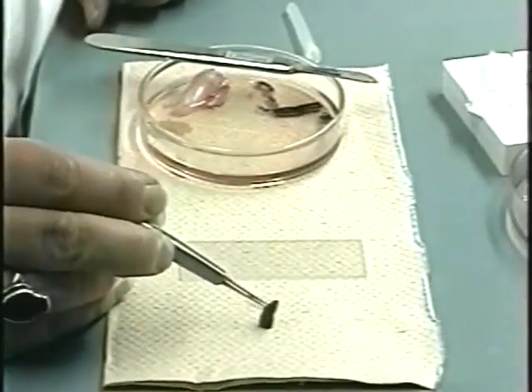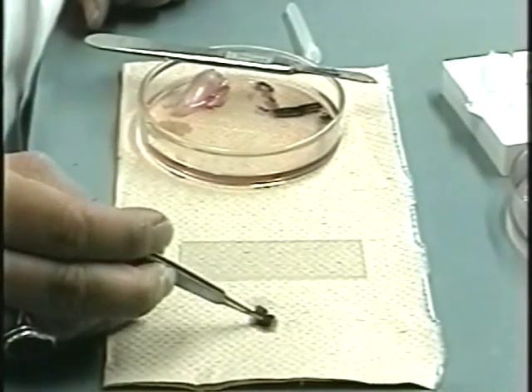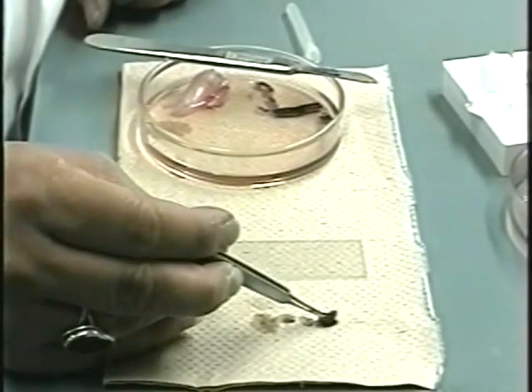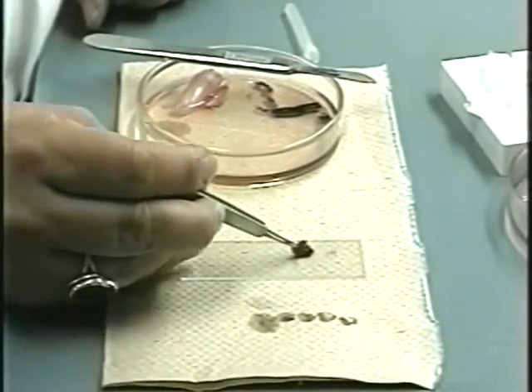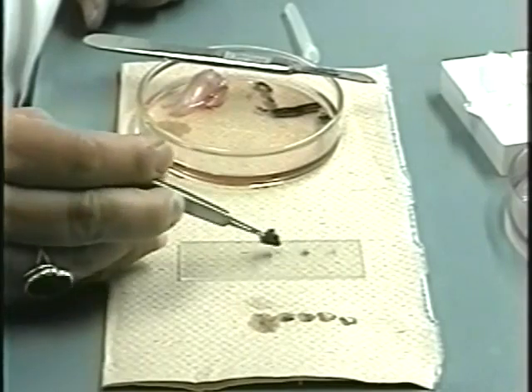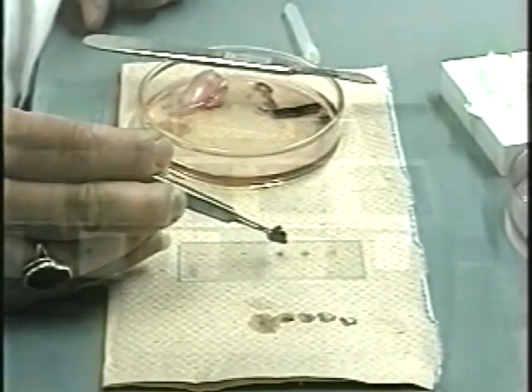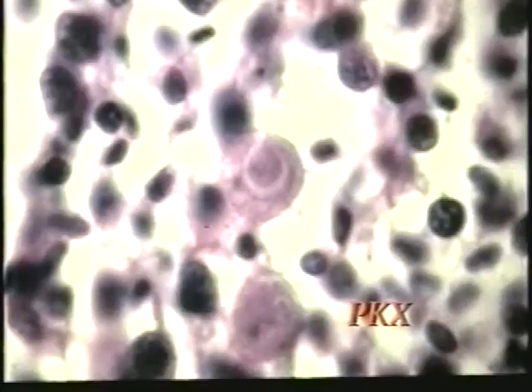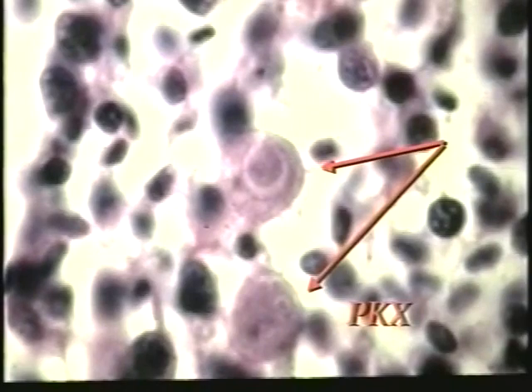If kidneys are grossly enlarged, it may indicate proliferative kidney disease. To examine for the PKX parasite, prepare an imprint of the tissue by excising a small portion, blotting off excess fluid, then gently impressing on a microscope slide. Let the smear dry, then stain with Giemsa stain. Look for round, lightly staining parasites that have one to several secondary cells within a primary cell.